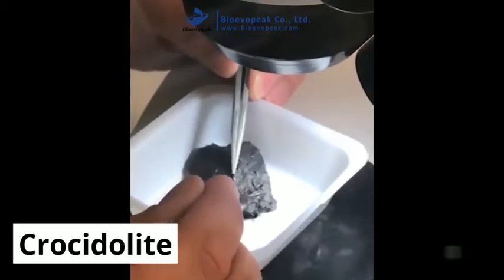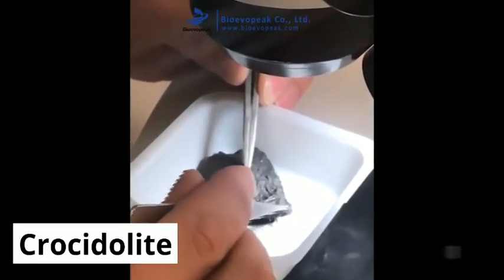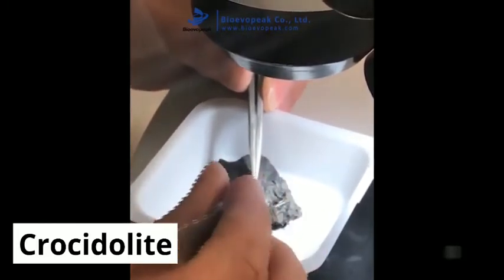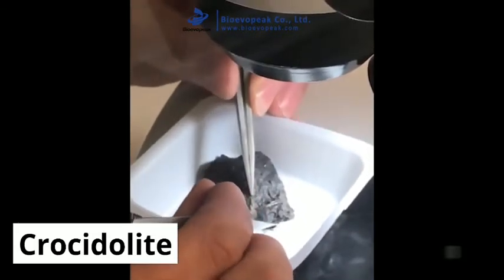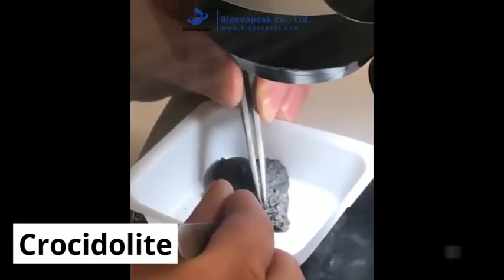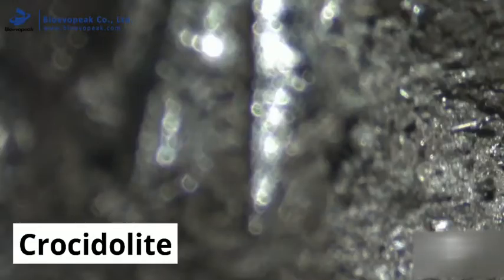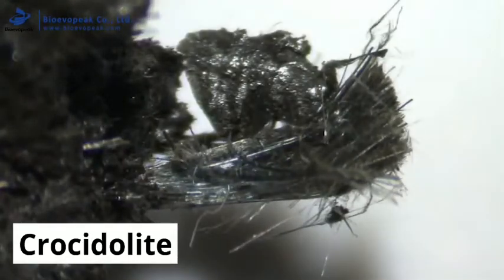This sample is of bakelite plastic, used historically to form products such as toilet cisterns, telephones, and door handles. First, the sample is prepared, and then, in a controlled environment, the sample is reviewed under the stereo binocular microscope in search of suspect fibres.